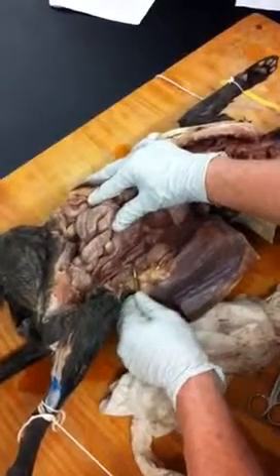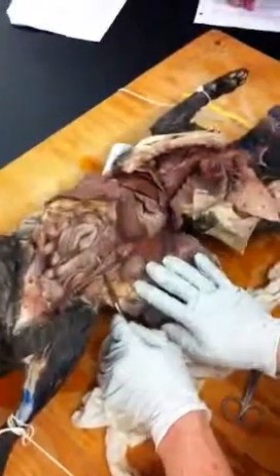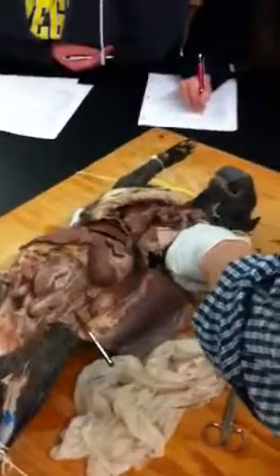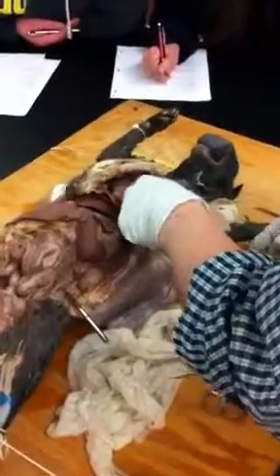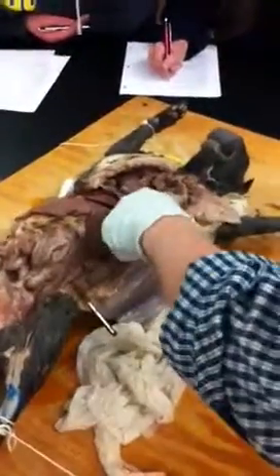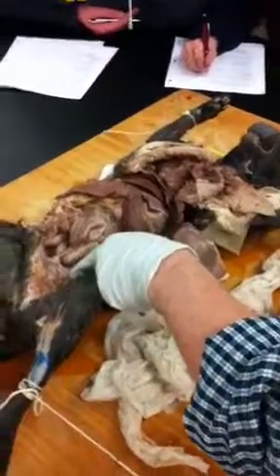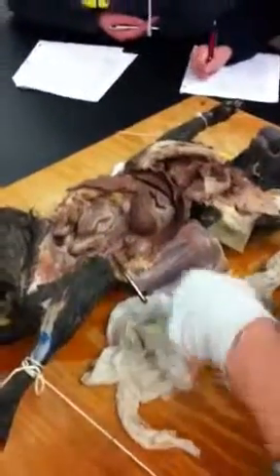So this large vessel that you see right here, can you see that? Everybody see it? That's the abdominal aorta. So it runs all the way down. It basically starts in here where it's called the dorsal aorta, which we can't really see because I haven't exposed that. And then it goes through the diaphragm into the abdominal cavity, runs along the backbone, and sends off branches to either side of the body. Okay? As it does so, we're going to look at several of those.